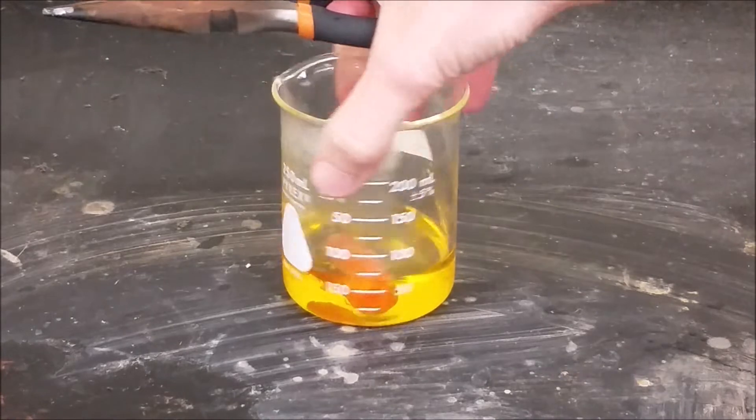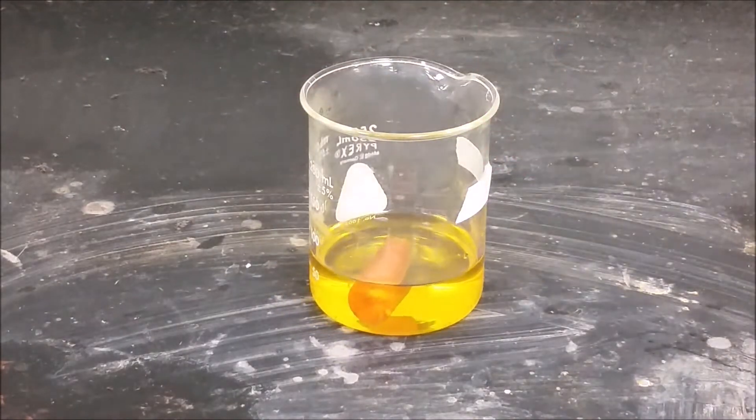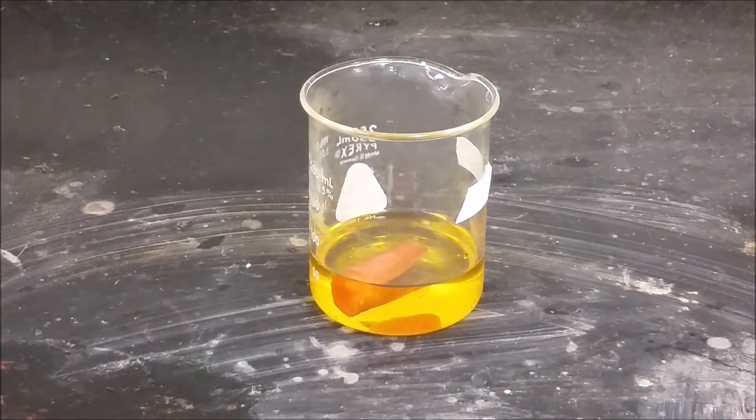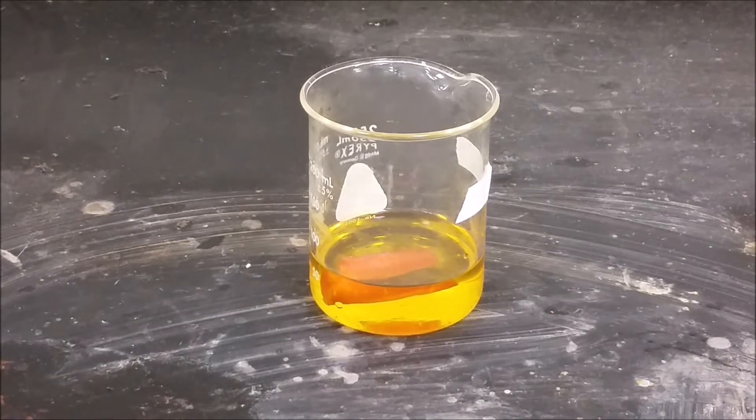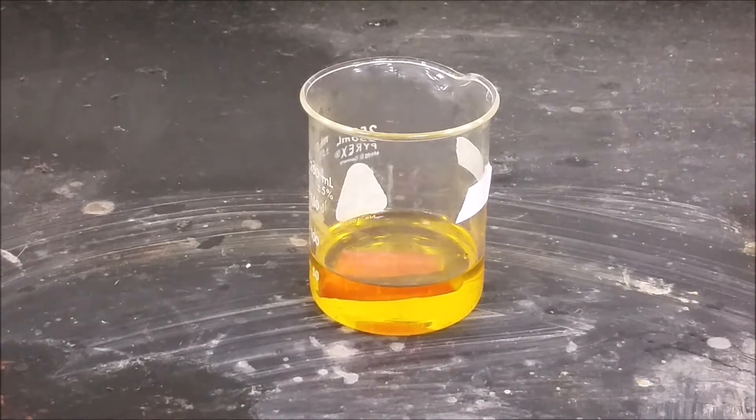And this time we're going to let the carrot sit in there for quite a bit longer. So we're going to put a couple of different sized chunks in. This first one is pretty large relative to the size of the beaker.